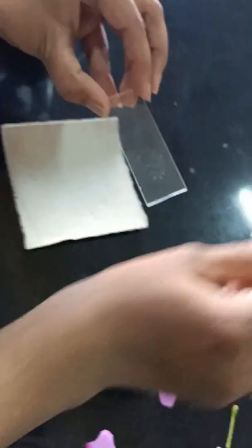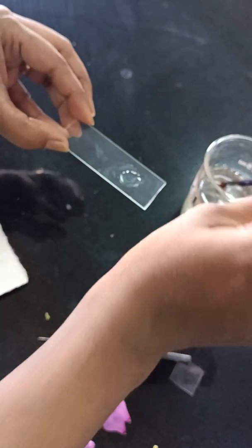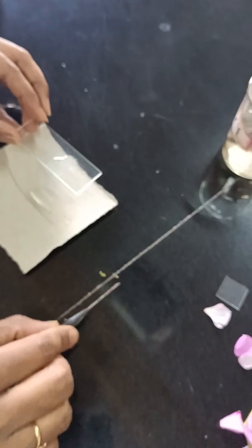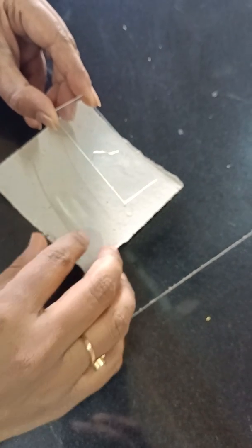Any easy technique you can follow. Once you dust the pollen grains on the slide, put sucrose solution over the area where you have dusted them to see germination. Germination time varies depending on different factors like climatic conditions; generally 20 to 30 minutes is required for pollen germination. After that duration, a few pollen grains will undergo germination. You need to apply the formula n/N × 100 to calculate the percentage of pollen germination, where small n is the number of pollen grains germinated and capital N is the total number of pollen grains.